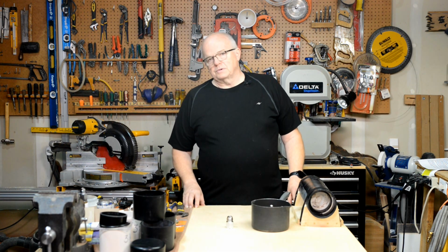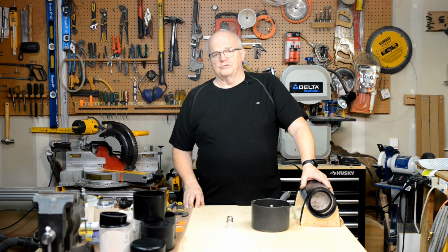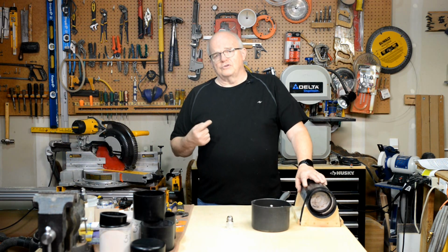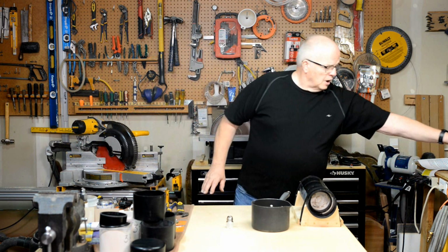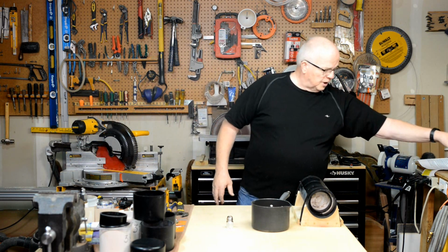Hello, and welcome to part 3 of a 3-part series that I'm putting together on how to build a particulate filter specifically designed and engineered to go between your freeze dryer and your vacuum pump. If you've watched part 1, I explain why you need to have a particular type of a filter that does a particular job. I explain why this kind of a cartridge filter doesn't work.